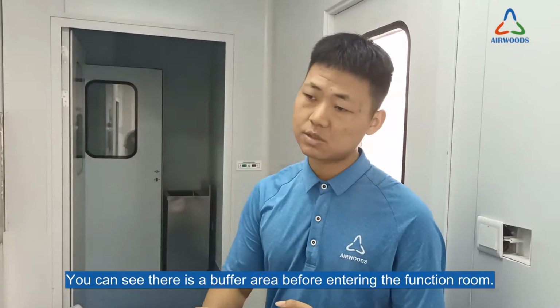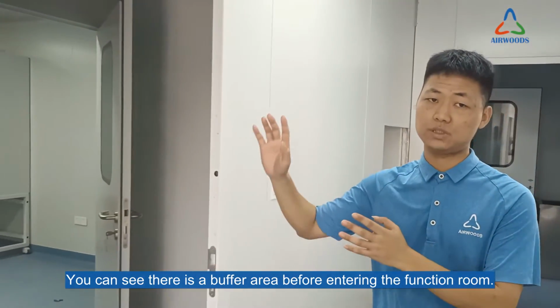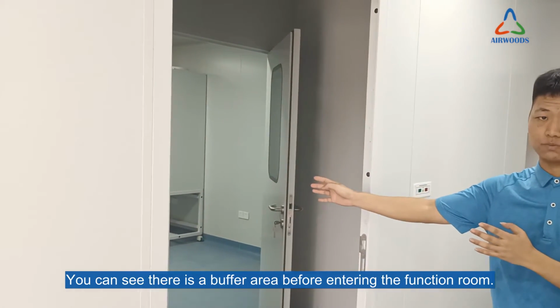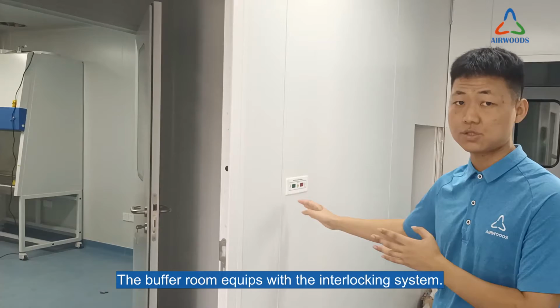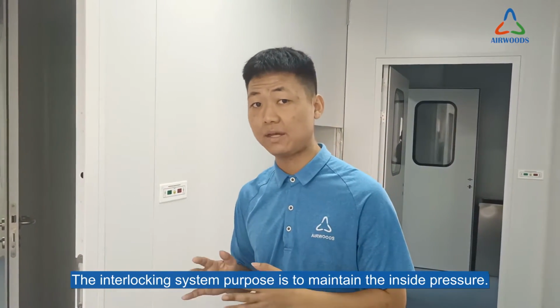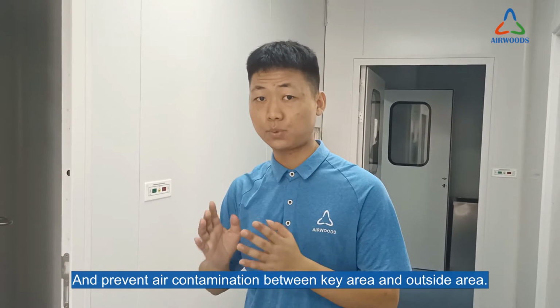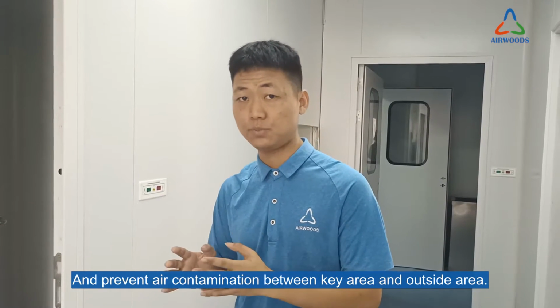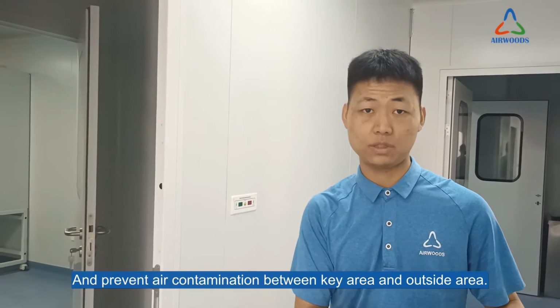You can see there is actually a buffer room before entering the main function rooms. The buffer room is equipped with an interlocking system. The purpose of the interlocking system is to maintain the inside pressure and prevent air contamination between the clean area and the outside area.